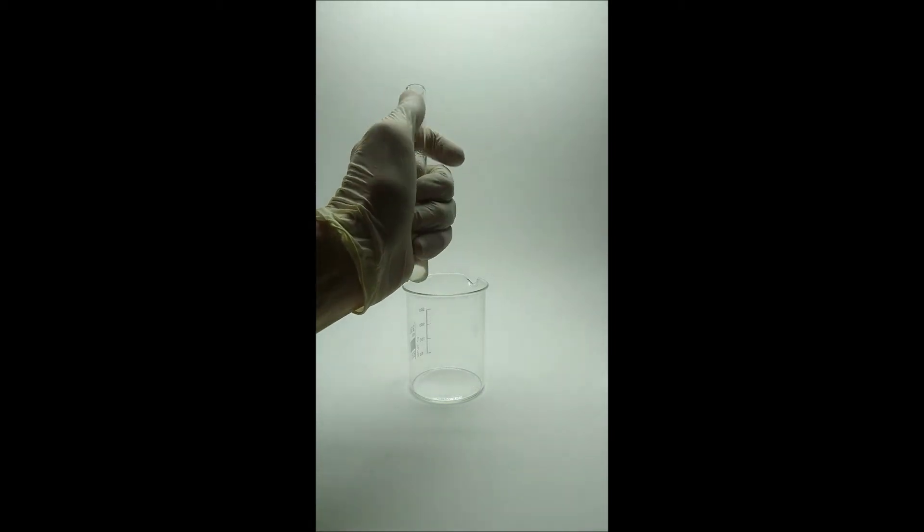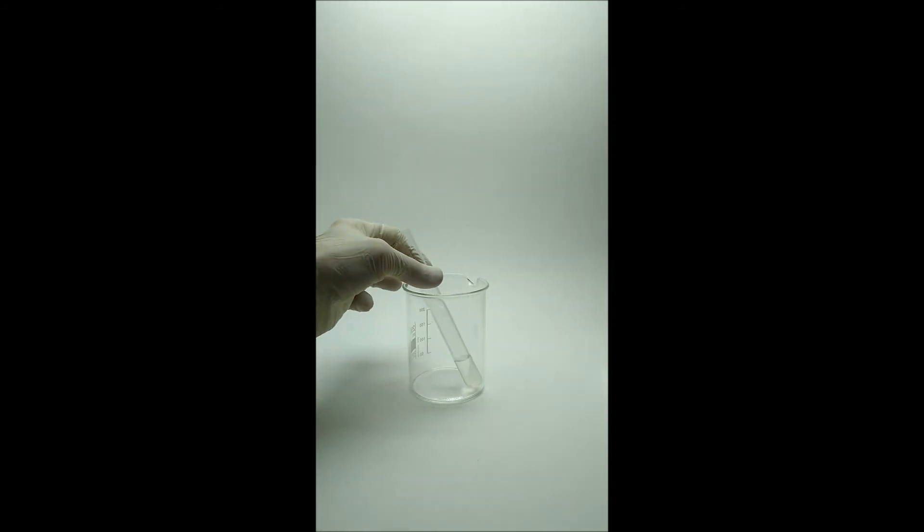Once the solution is cool to touch, you can add it to distilled water.